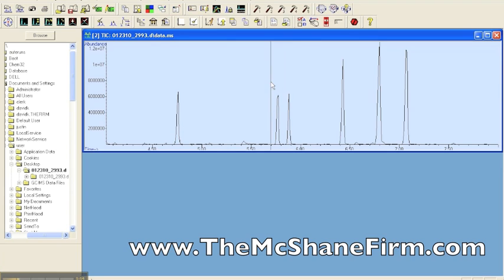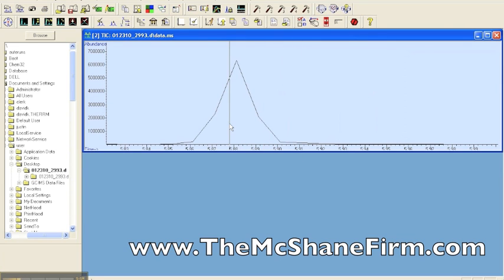And so, for example, when we zoom in on our third peak that's here, we would right double-click, and if it was a well-resolved peak, then it shouldn't matter as far as the reporting in the NIST spectral library. Wherever you right double-click should come to the same result. And we're going to see how this does make a difference in real life. So where you click should determine what result you get.